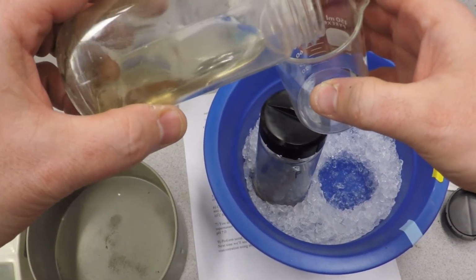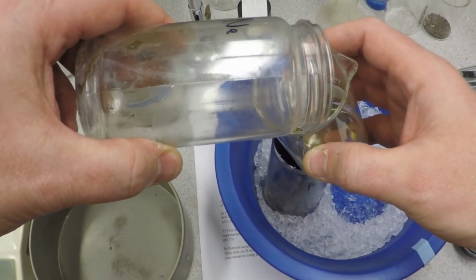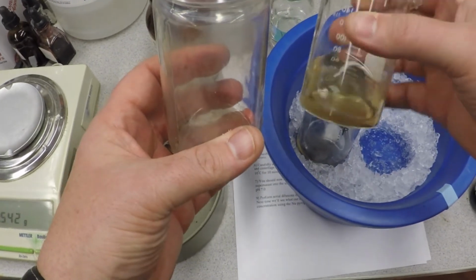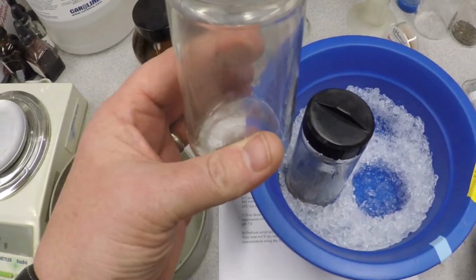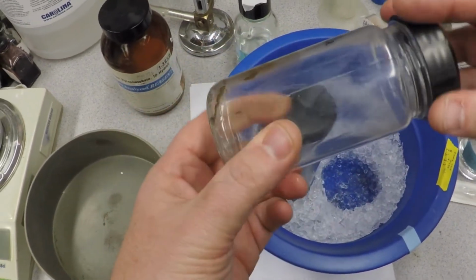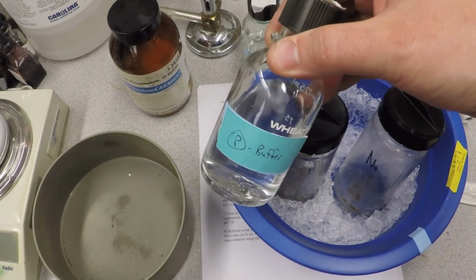But you just very carefully turn this over. Now that pellet is pretty tight. At 10,000 times G, not much should come out of there. But you let all that go. That's all can be tossed, because this is not what we want. Our bacteria are in this pellet down here. Holy shnikes. Resuspend this pellet in 5 mils of buffer. In this case, we're just going to use the plain old phosphate buffer that's going to be supplied to you.